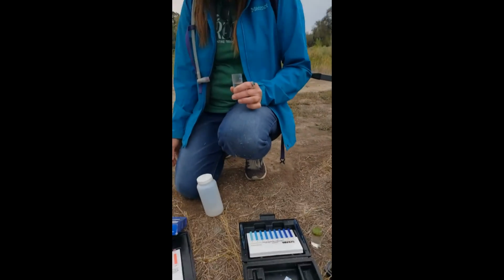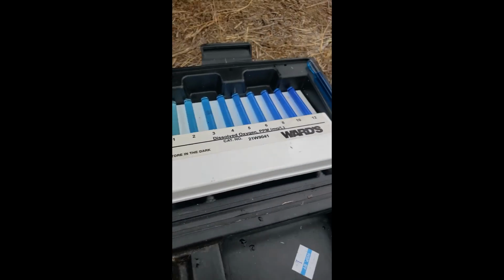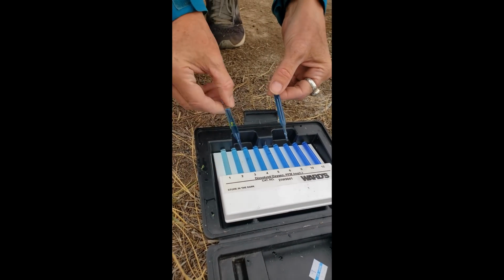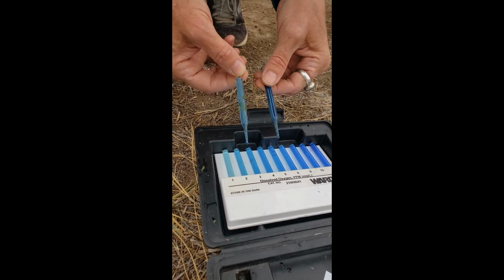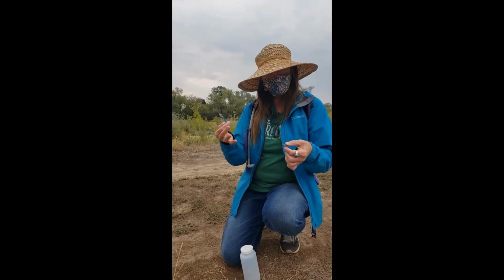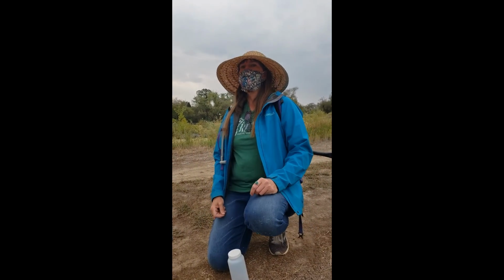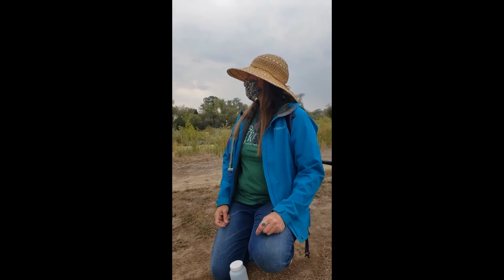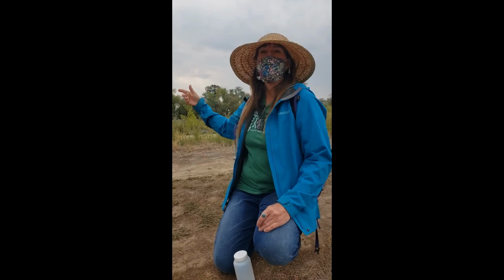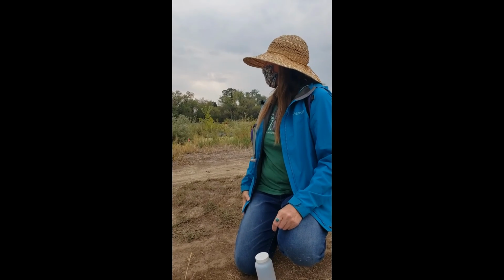And we just found out, will you tell us what we found with the dissolved oxygen? We compared dissolved oxygen from the Jordan River and the pond. The Jordan River sample comes in at about a 4, and the pond sample comes in at about a 2. So there's half the dissolved oxygen in the Oxbow pond than there is in the existing Jordan River. That's interesting to think about. What could that mean, or why could that be? Because the outflow is kind of blocked currently, so it's just collecting and not flowing. Flowing water gets oxygenated as it flows.